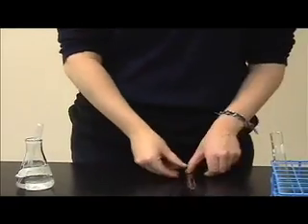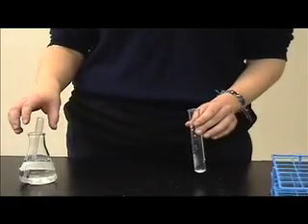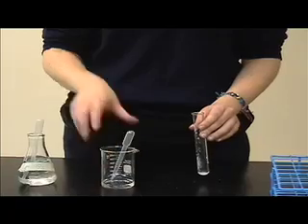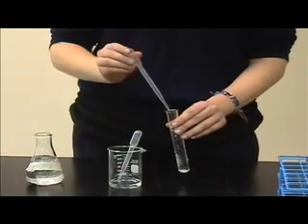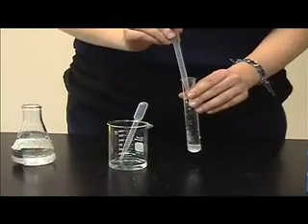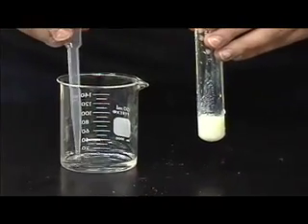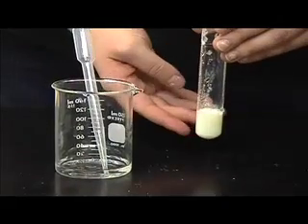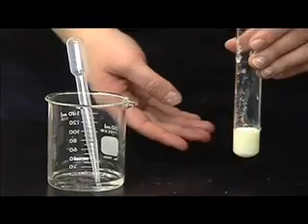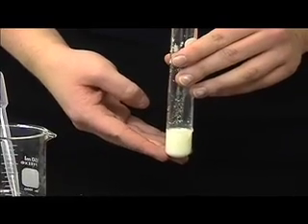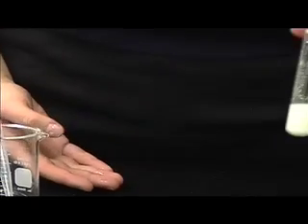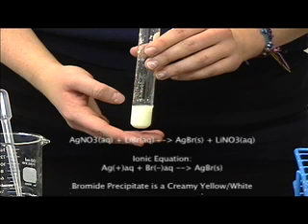Make sure to close the container. And then you're going to be adding dilute nitric acid, followed by about three drops of silver nitrate, and it should form this creamy yellow-white precipitate. And later you'll see that to test the halogens, you can use ammonia, but we'll save that. And there's bromide. Bromide is a precipitation reaction, as are the other three halogens. So the silver nitrate will combine with the lithium bromide to yield a silver bromide and a lithium nitrate.